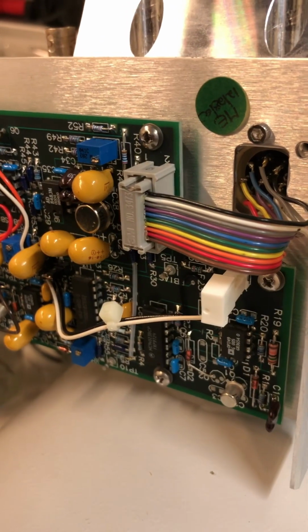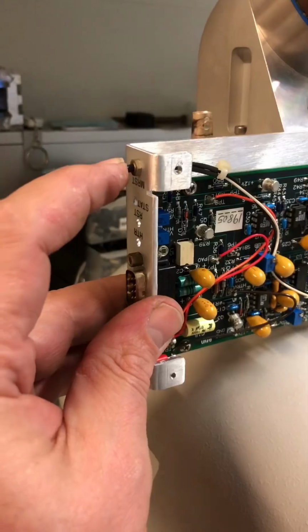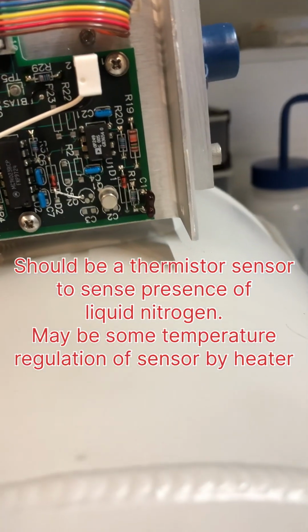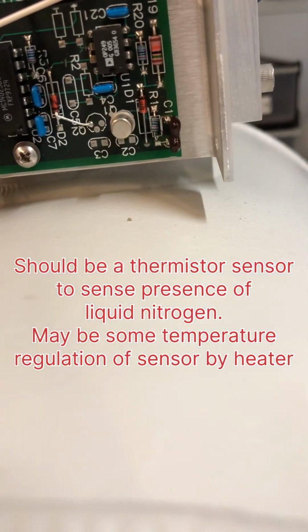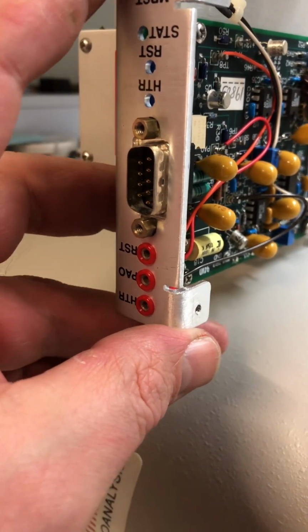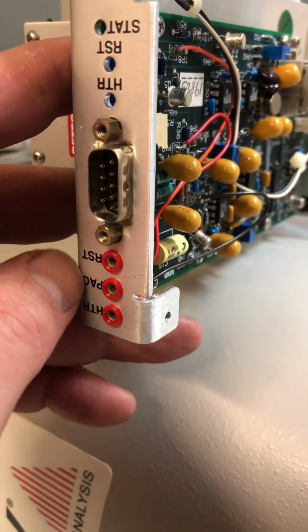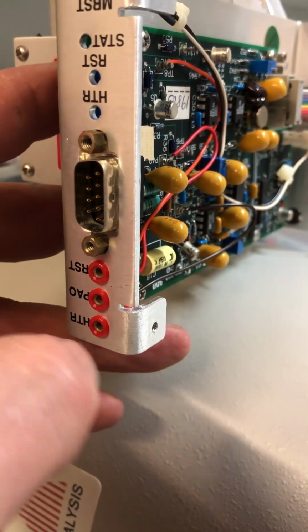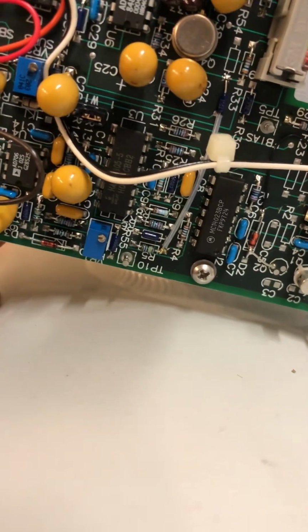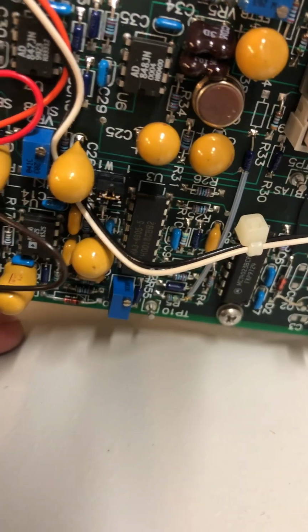First input transistor is 2N3811T. There is a knob for reset short detector, and there is also an operational amplifier OP249. Now I start to understand that this could be high threshold, analog output, pulse analog output, and something like reset. The Motorola chip is actually digital gates, and the HA chip is for comparators.